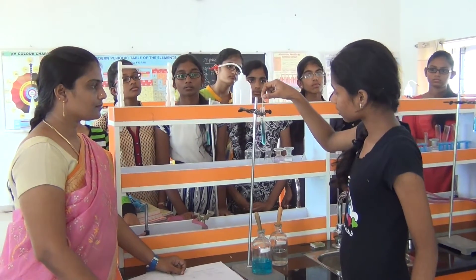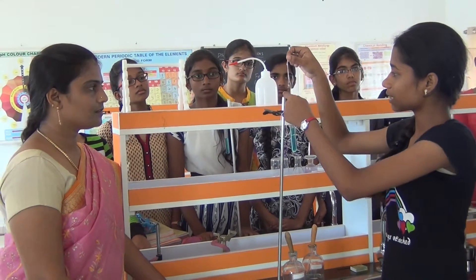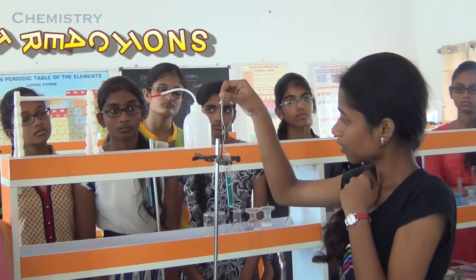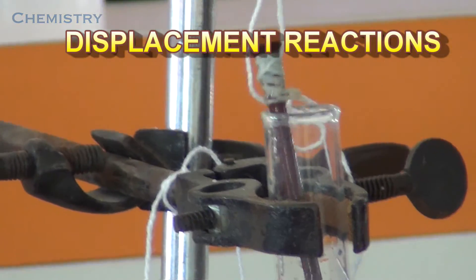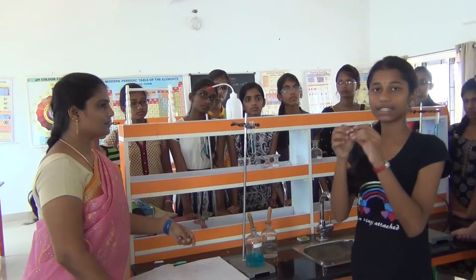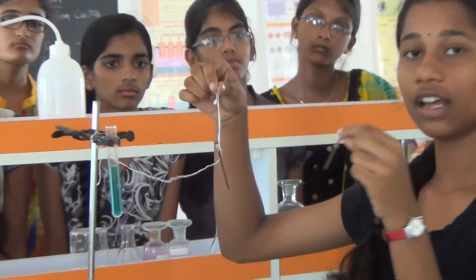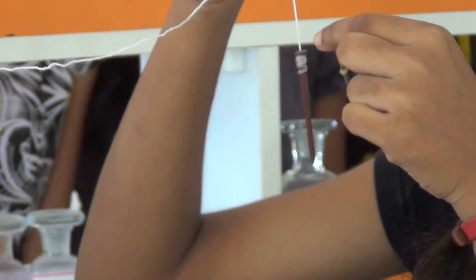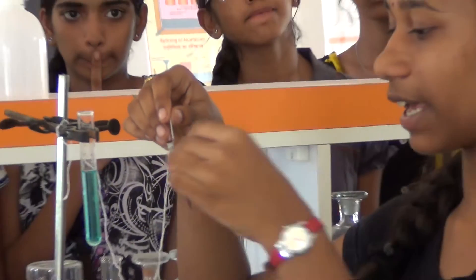So this reaction is going to start. Did you see this? There is colour deposition on this iron. This is copper that is found on the iron. See, this is iron which is not in the experiment. This is iron which is in the experiment — it has a reddish brown deposition on it. Therefore we can say that copper is there on it, but this is a pure iron layer which does not have anything.